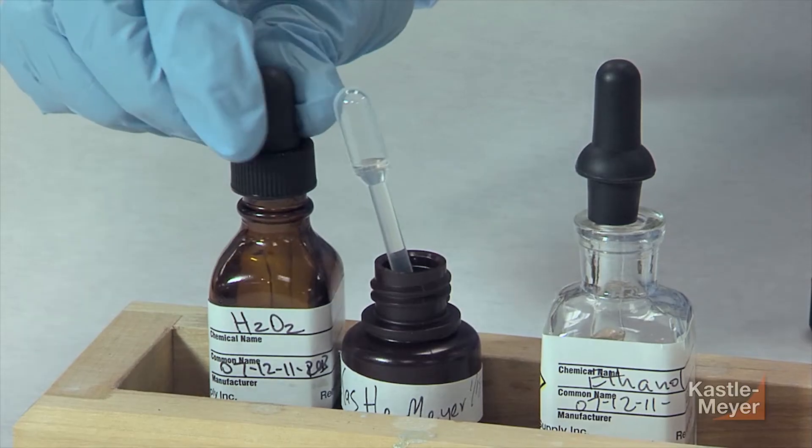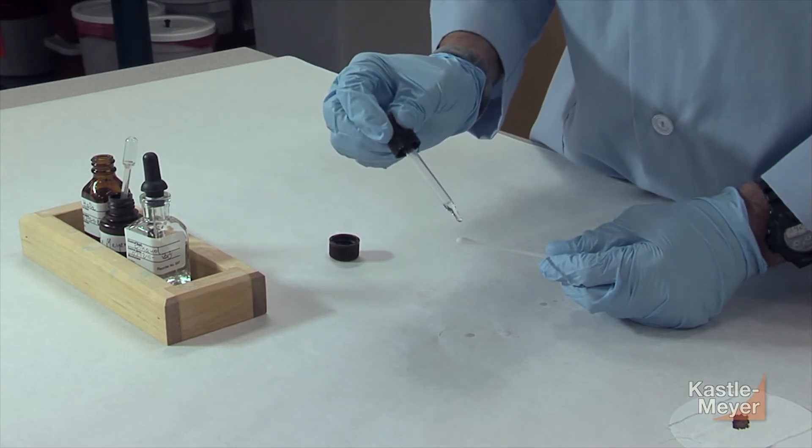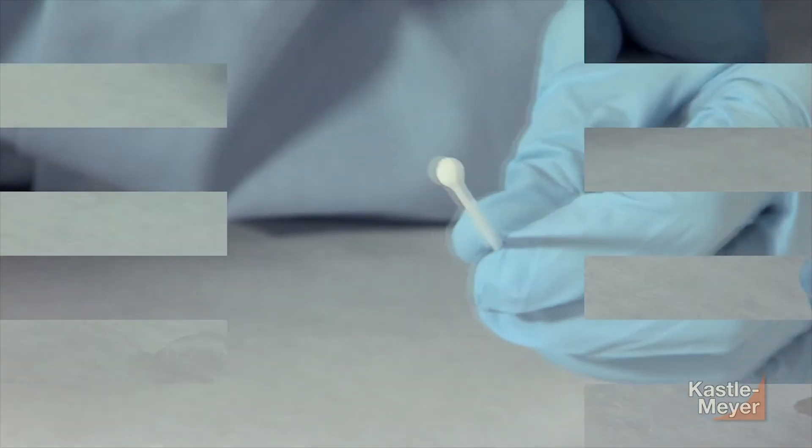Finally, add a drop or two of three percent hydrogen peroxide. A positive result will be indicated by the immediate presence of a pink color.